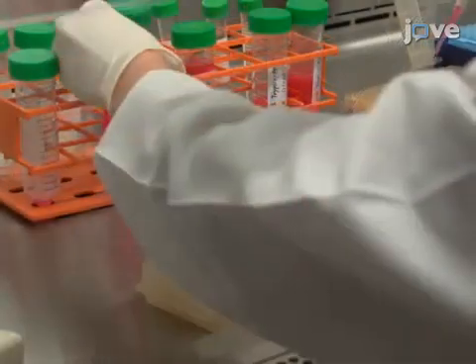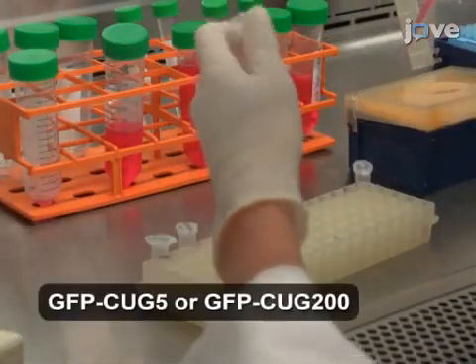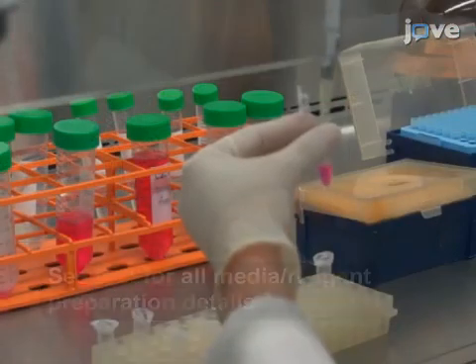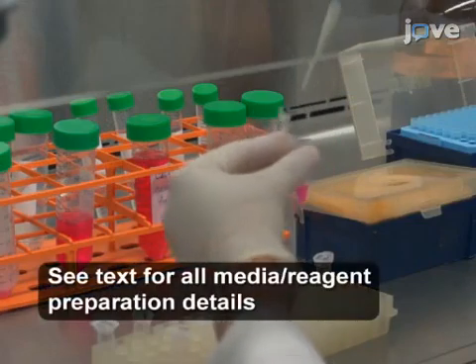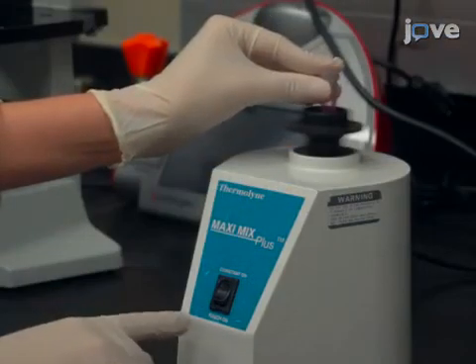The next day, add 2 micrograms of the plasmid DNA of interest into 200 microliters of room-temperature serum-free medium and briefly vortex the solution.